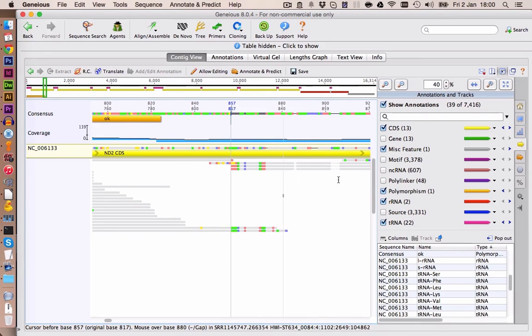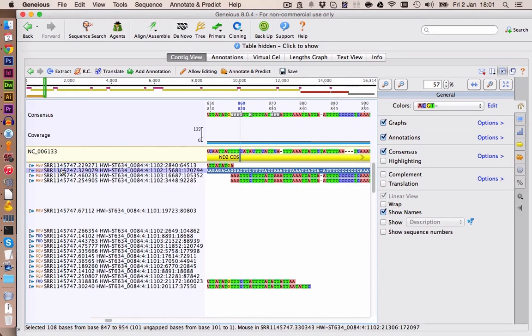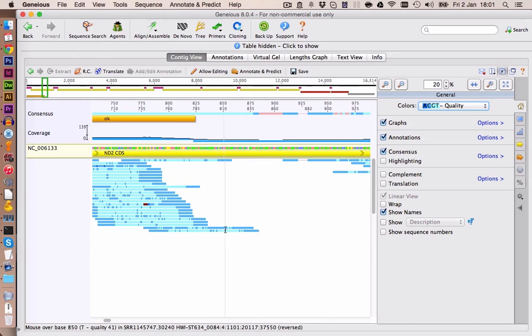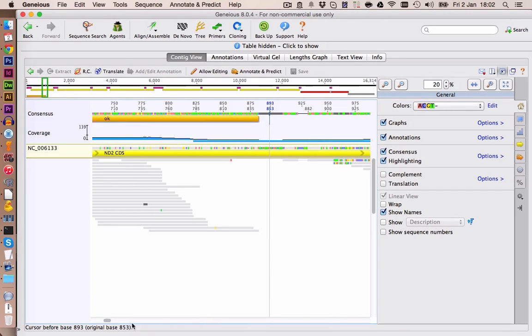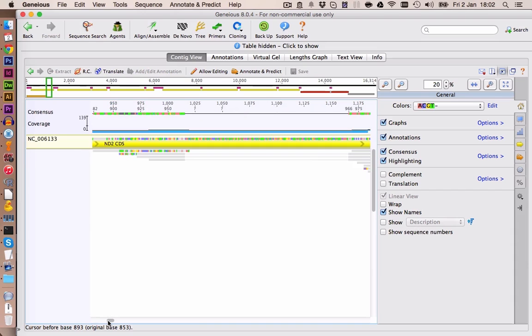But here we have regions where we are not too sure anymore. From the first look, this looks quite similar, but it probably isn't, because the overlap here is very short. So we're also going to delete those sequences here. And we probably can rely on those down here, because they have a good overlap with the rest of the sequences. Also, if we take out the read quality, they are looking fairly okay. So up to here, the sequence should be okay. Let's save this one. Then we have a big gap. Those sequences here don't make too much sense. But they are here probably correct.